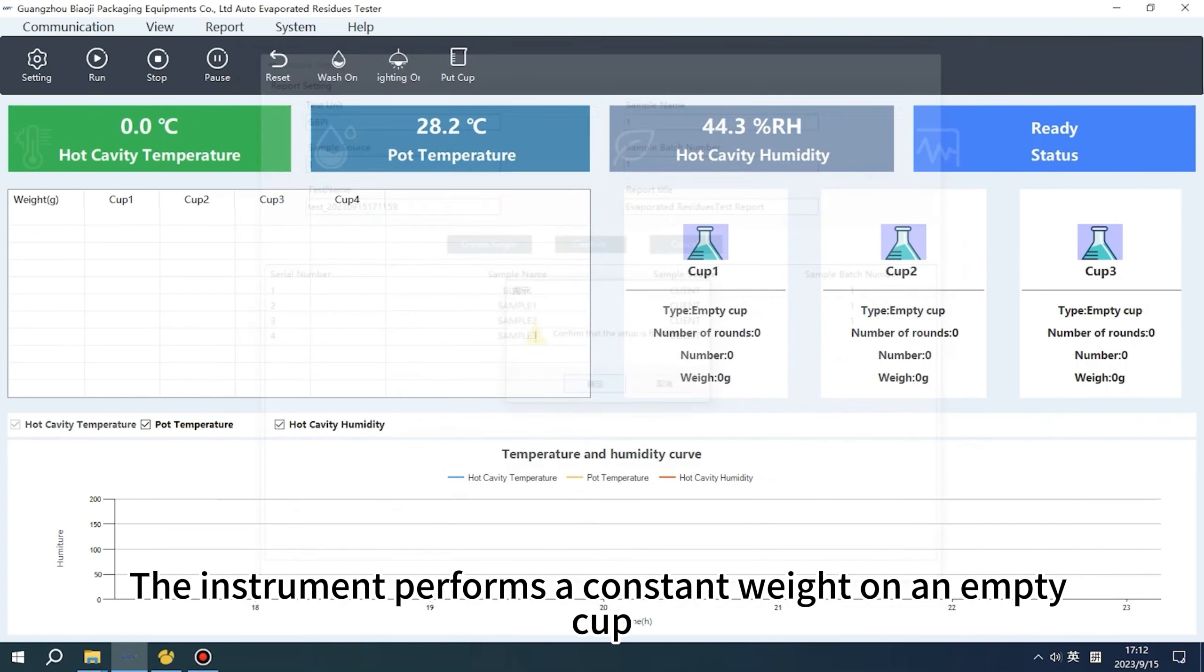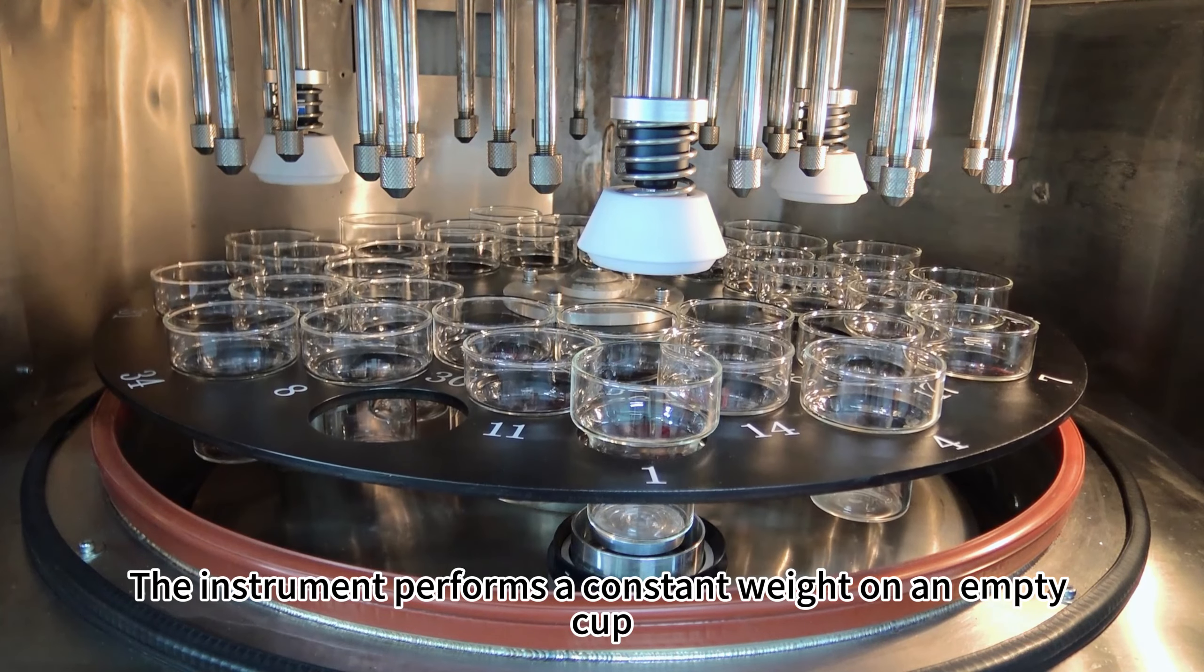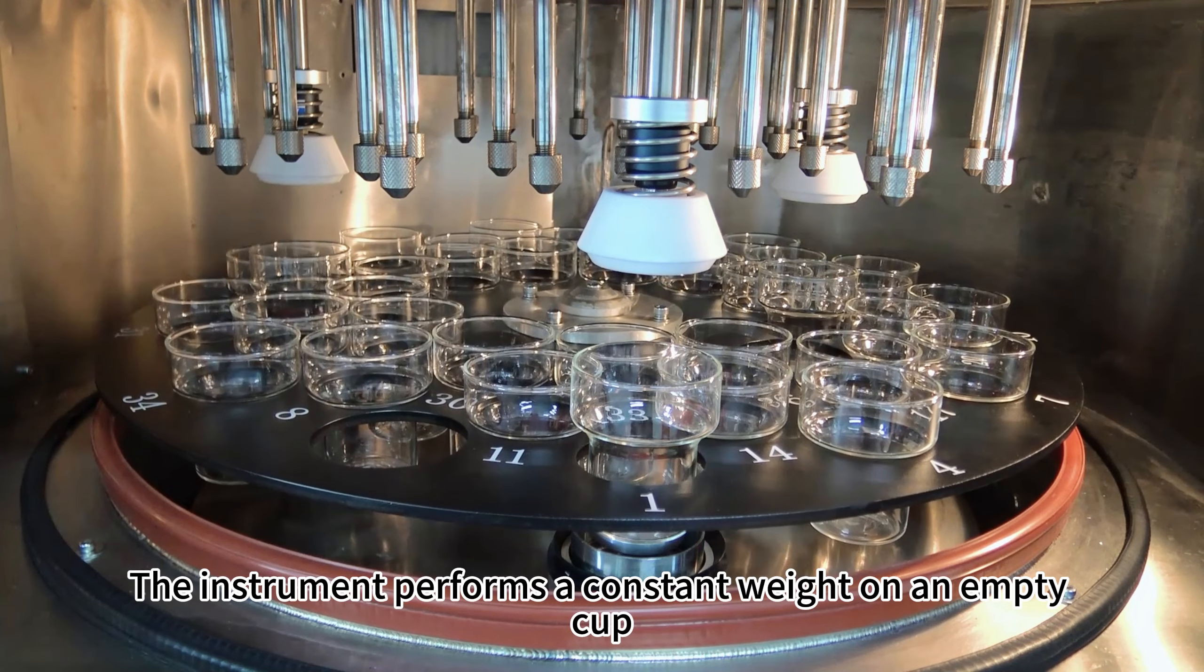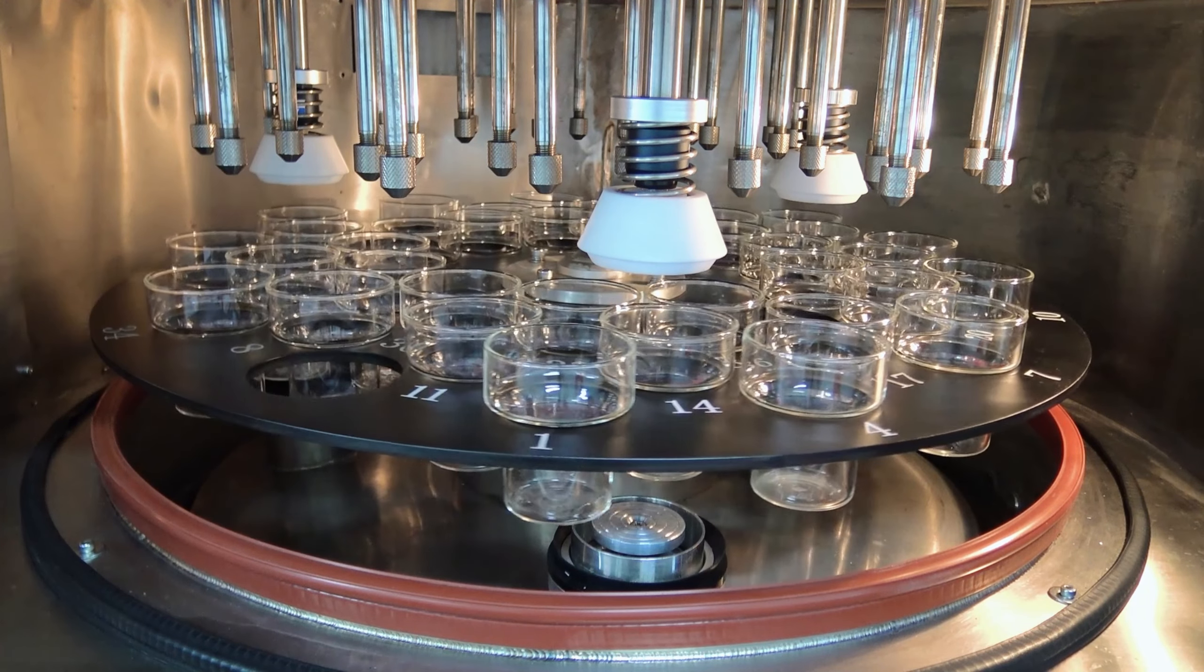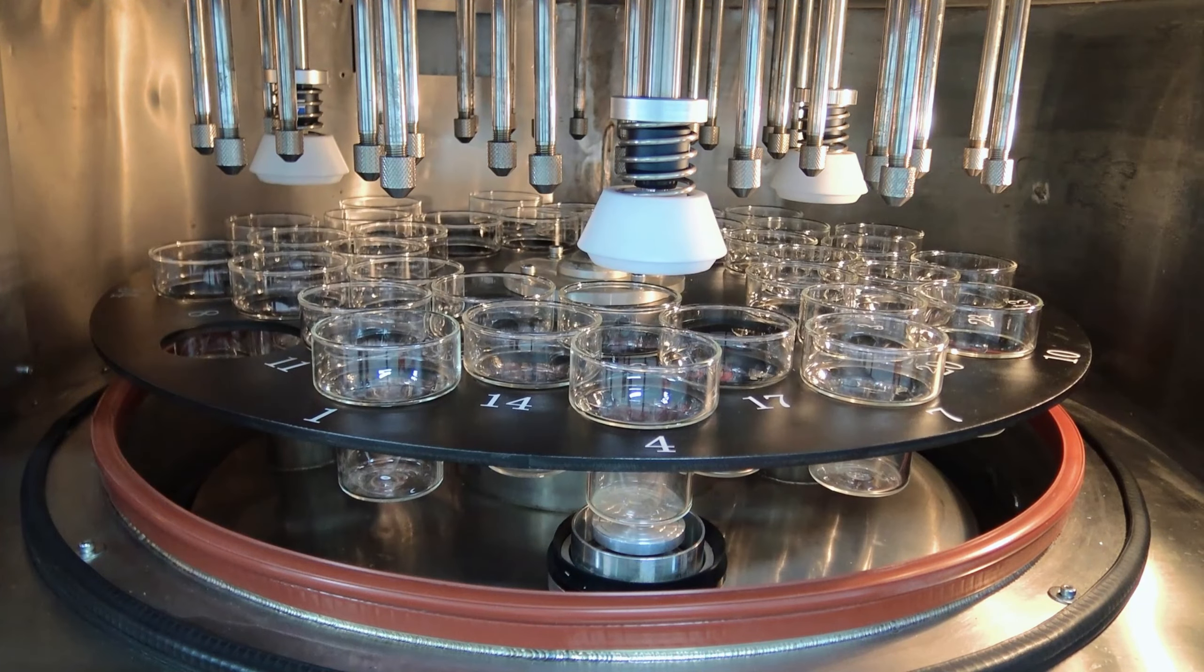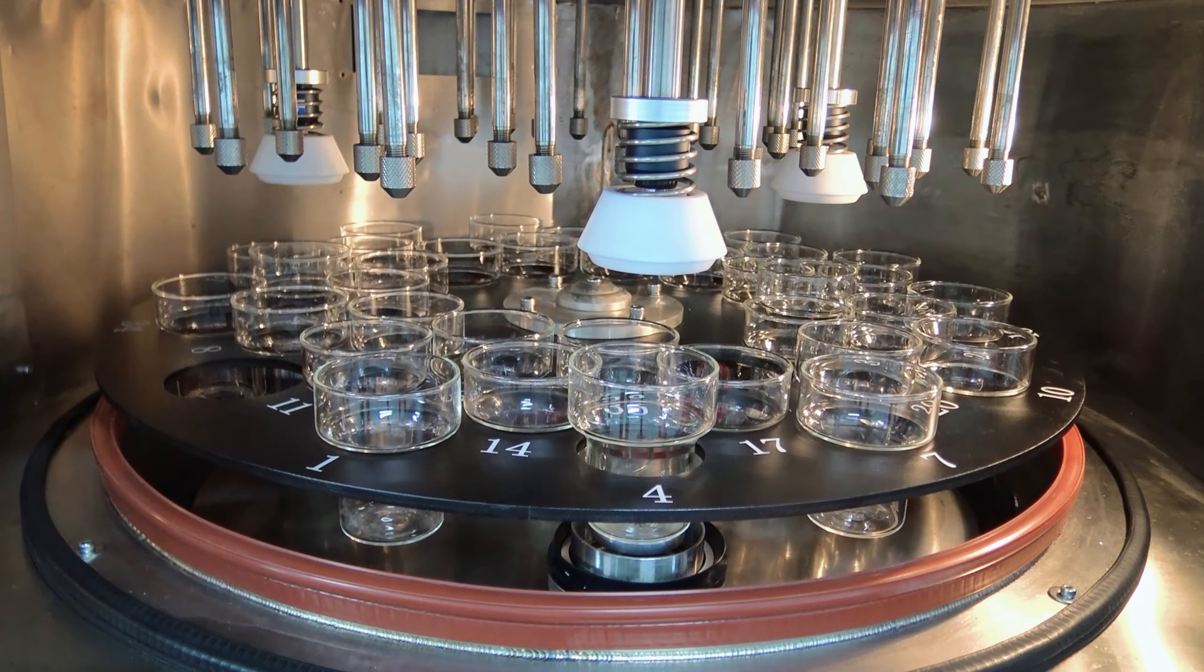The instrument performs a constant weight on an empty cup.